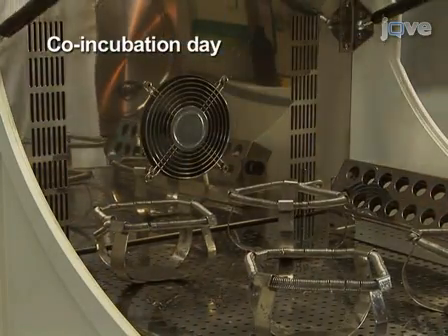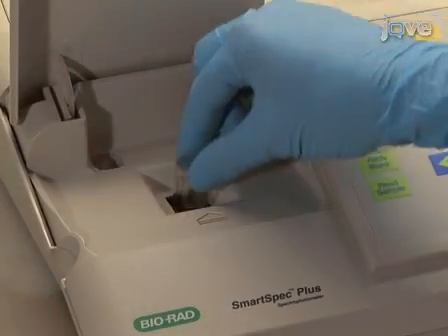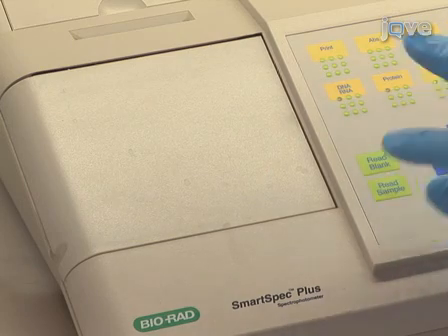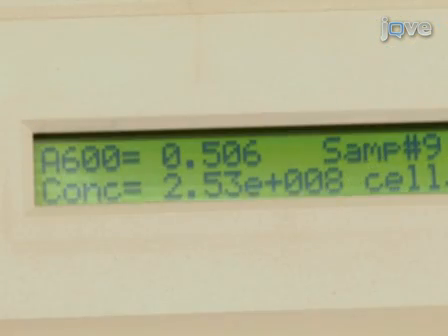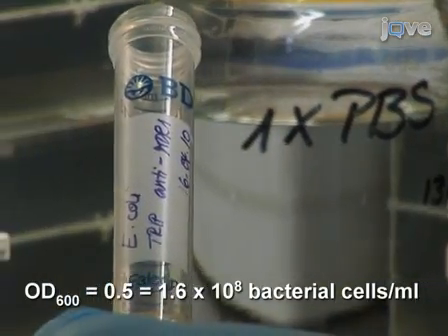Before starting the cancer cell infection, measure the optical density of the overnight cultures of the tkRNAi vector-containing E. coli. Determine the OD600. Dilute the bacterial solution to an optical density of 0.5.